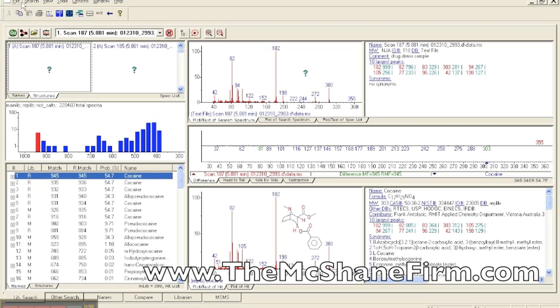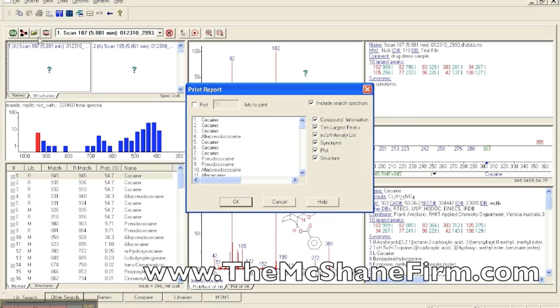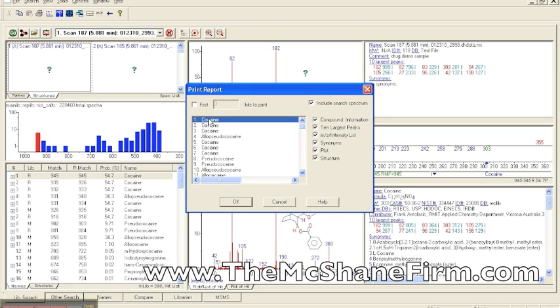So if you went in here and you hit print and you did the auto report, what the auto report will do on the print is that it is set by default not to do 10, because that's what I did before, but to do 3. If you only do 3, then if it's the top 3, you see that there's no possibility of anything other than cocaine. Over here, you can decide what else you want to print out on the report.